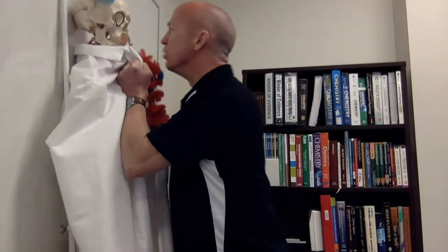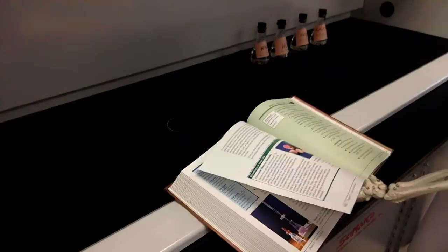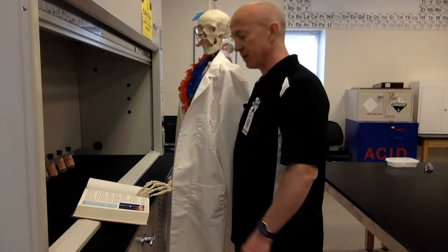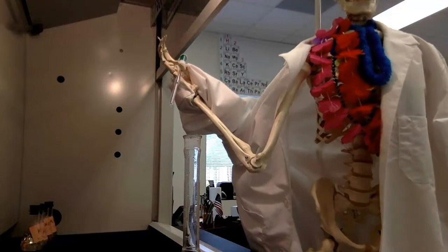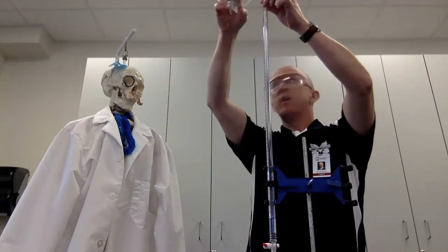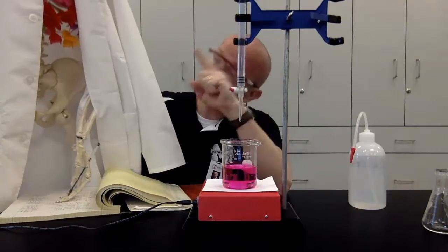Previously on Overdramatic Chem Lab. What did you do? What did you do? Look, there's no one else to blame but yourself. Always label our flask. You did this. No, it's on you. What? Oh, are you certain? That's pretty risky. You think it'll work? So let me get the solution ready. I'll get the burette set up. You relax. There's a lot riding on this. Yes. Please tell me you got that. Ugh, this can't happen again.